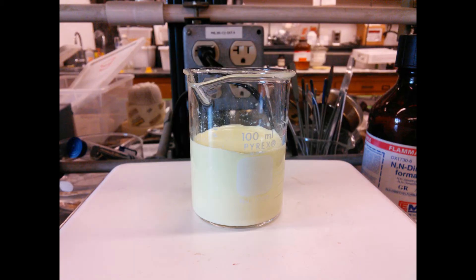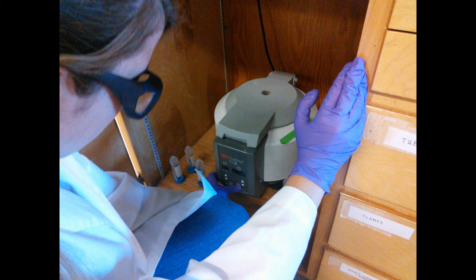The tungsten oxide condenses to form a pale yellow suspension. The resulting solution is spun in a centrifuge to drive particles out of the solution. The liquid is disposed of and more water is added to the remaining solid.